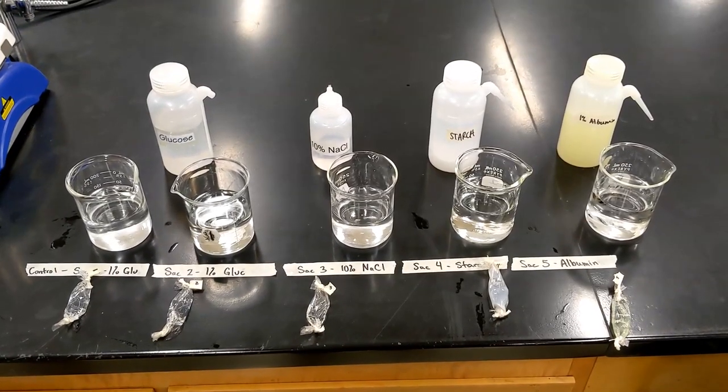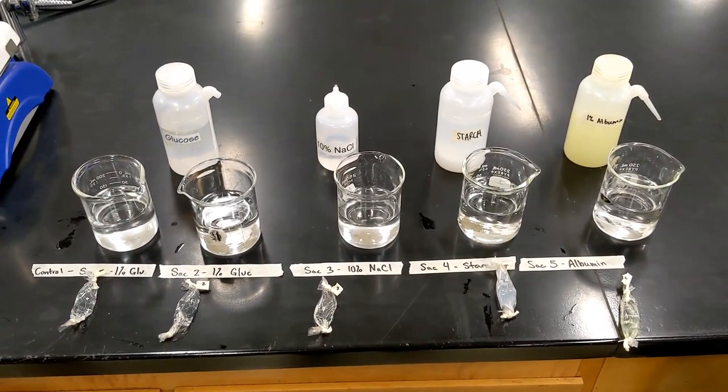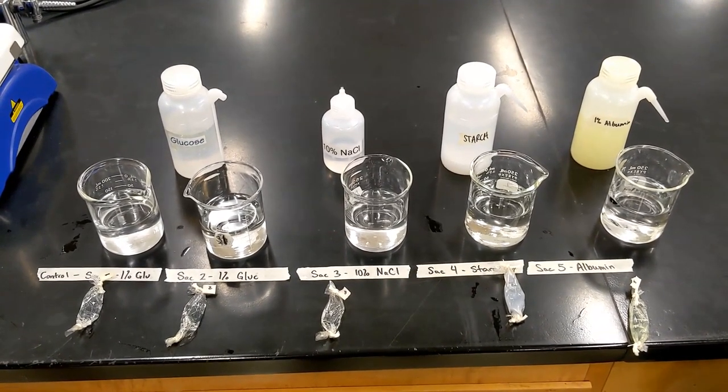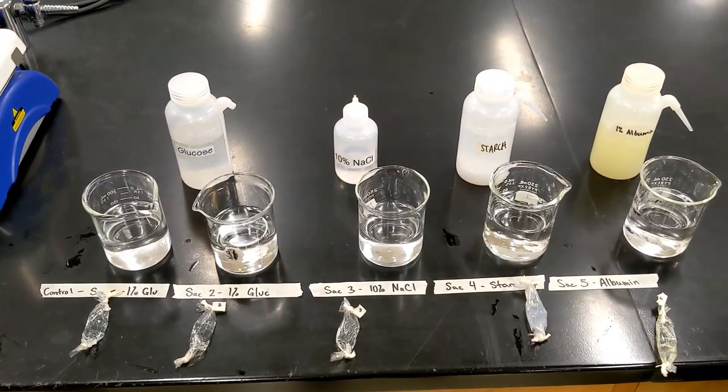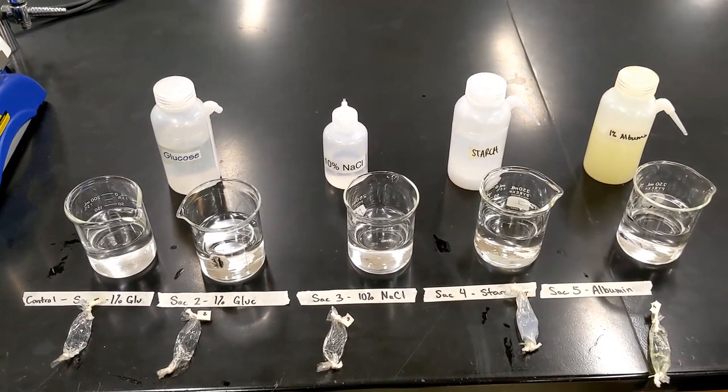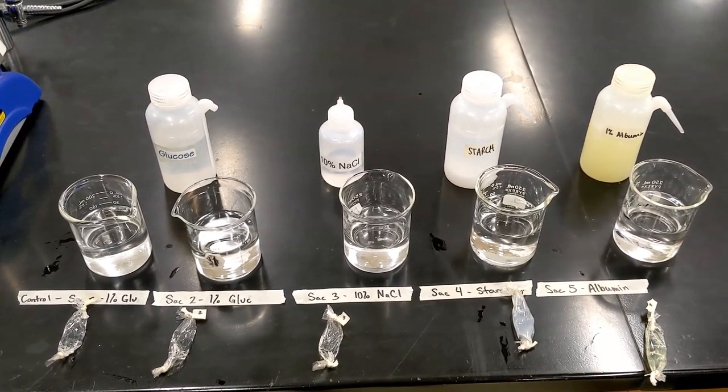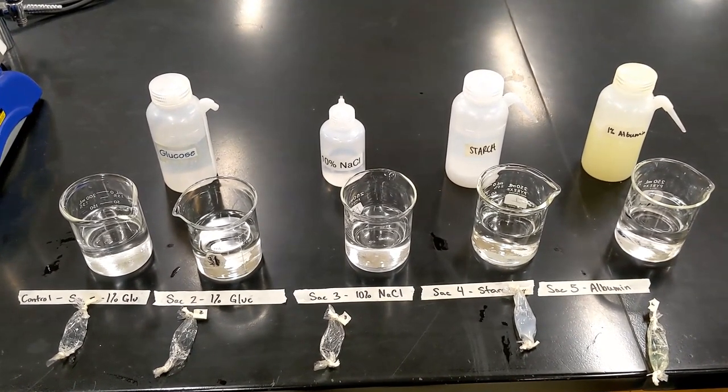At this point, we have weighed all the bags, one through five, and we now will place them into their designated beaker at the same time. They will be submerged for an hour, so follow the lab protocol.